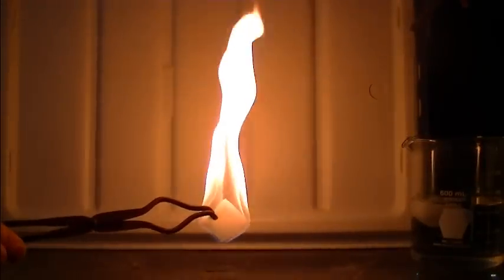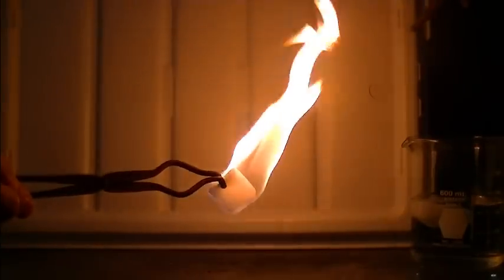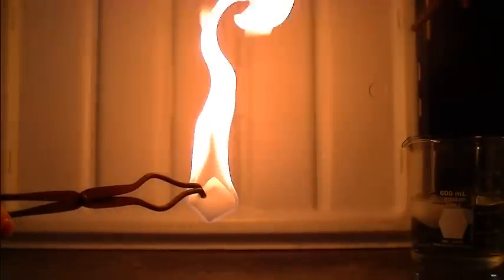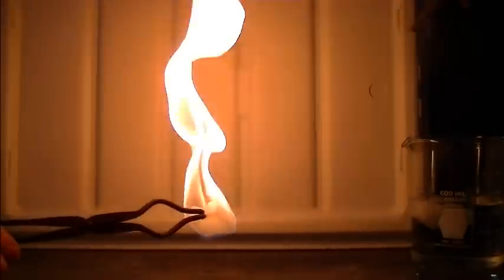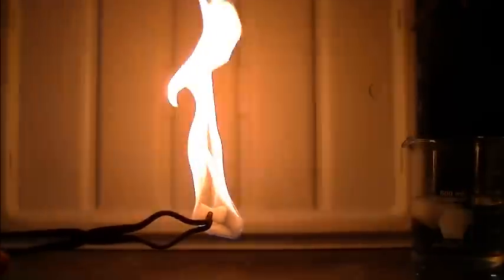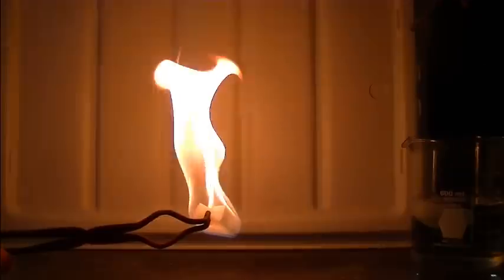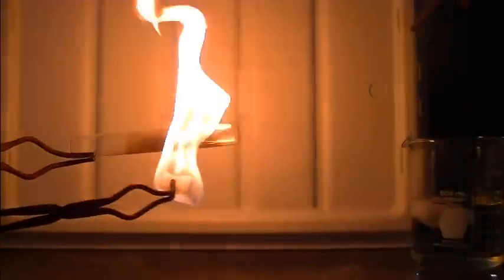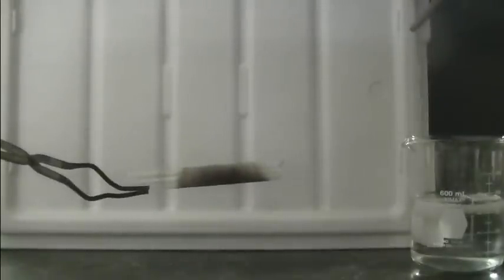What you notice with the isopropanol is a very bright orange yellow flame. That is indicative of incomplete combustion. Very little blue in the flame, so there's not much complete combustion going on. I'm going to take this test tube here and run it through the flame. And almost immediately you can see the formation of some sooty residue on the test tube.